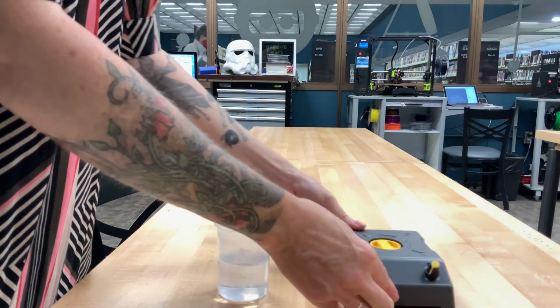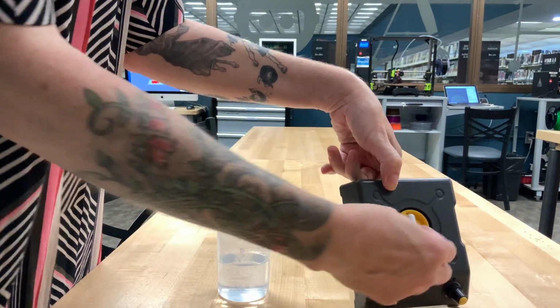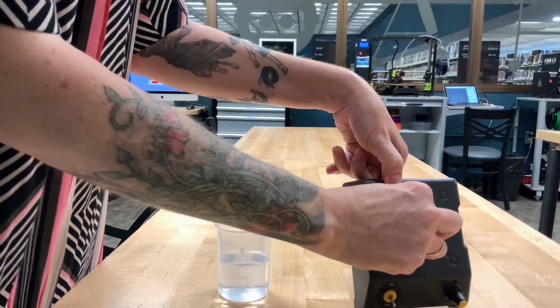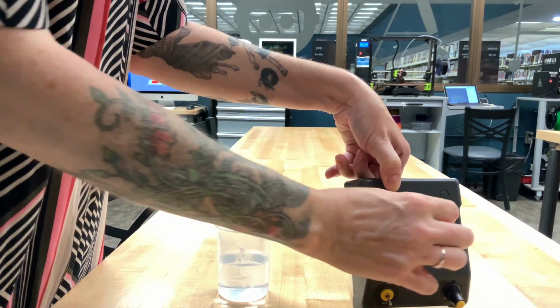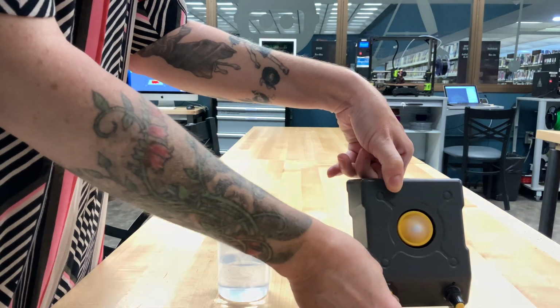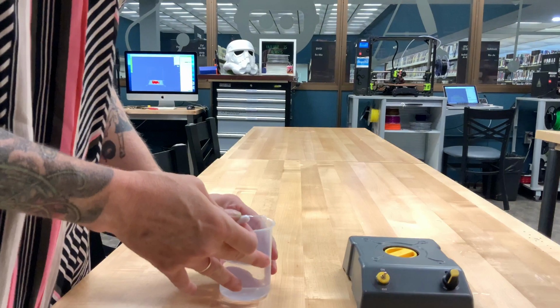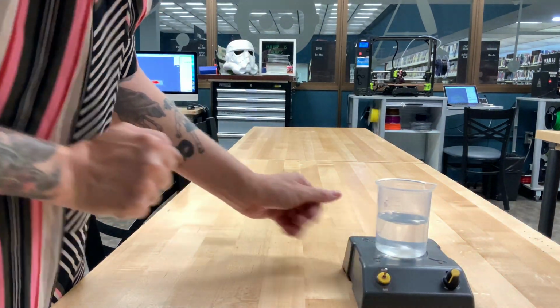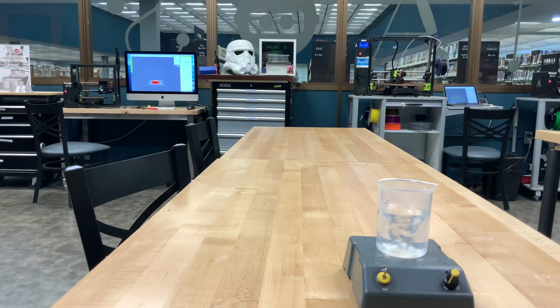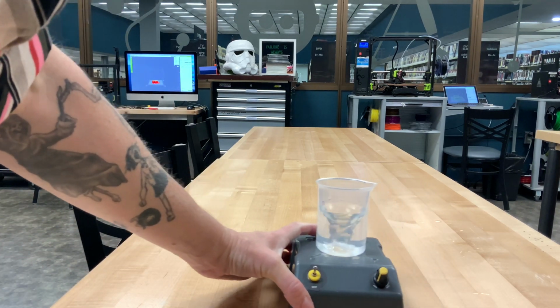Okay, so this is one of my favorite toys. It's going to help us mix. It has this magnetic pellet, and when we turn it on, that middle bit spins, and it's going to spin that pellet around. We won't actually leave it like this. We're going to take that pellet, we're going to put it inside our plastic beaker, and then when we turn it on, it spins and does all the mixing for us, which is pretty cool.